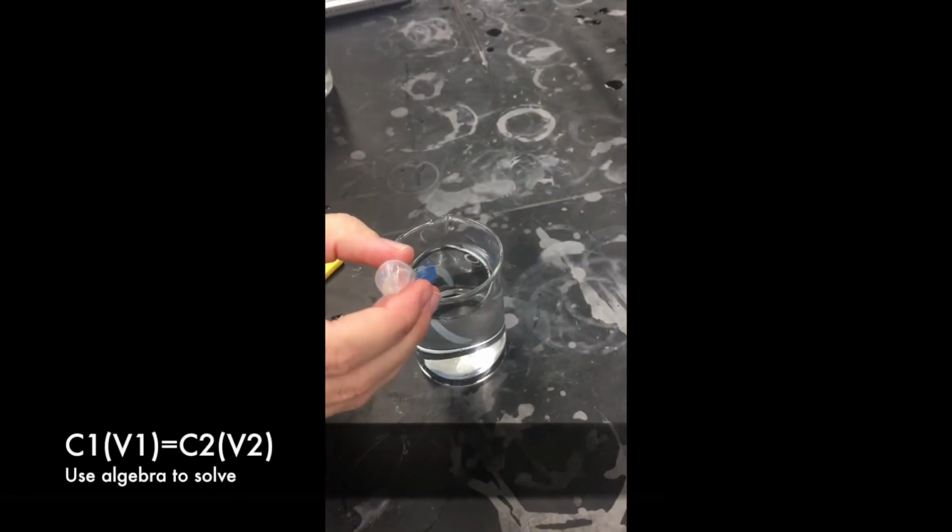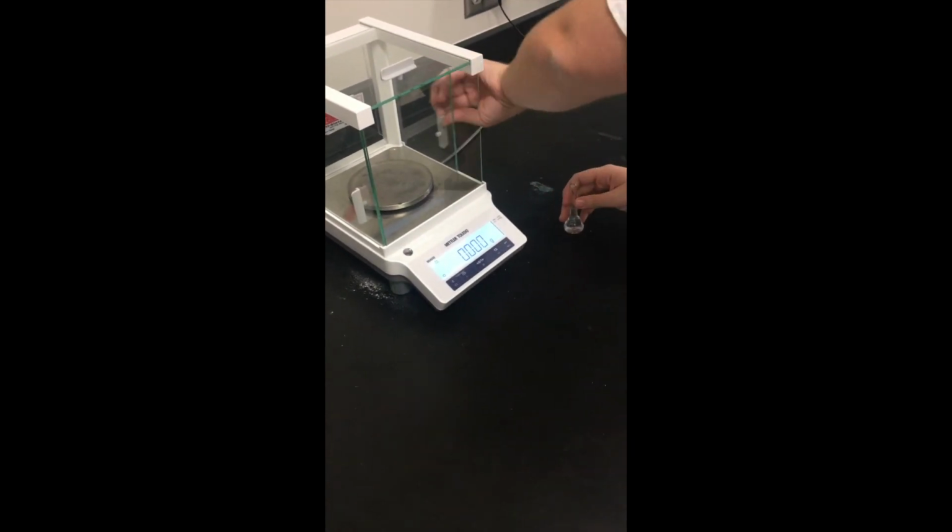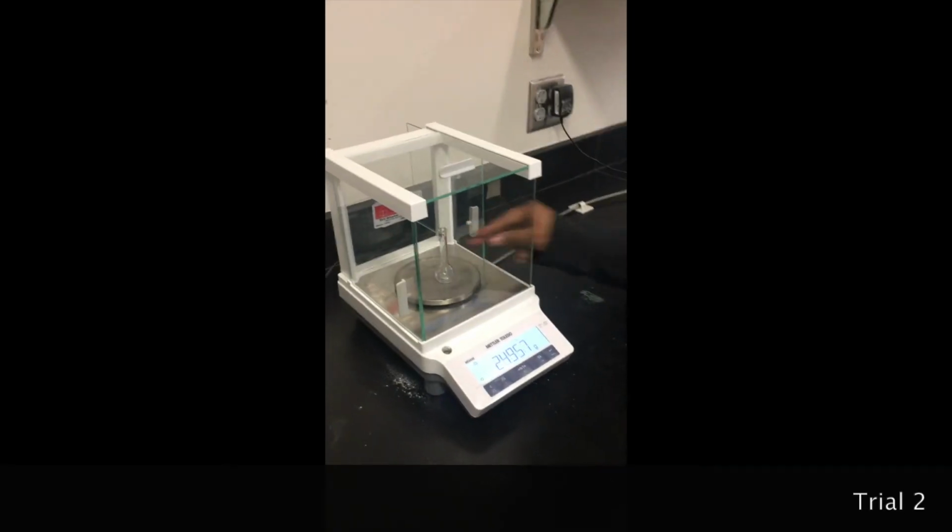Transfer the solution from the pipette into the appropriate glassware. Here we are adding water to the solution to reach a certain point. This will be our V2. You will use this formula to get the concentration of the new solution. Take the mass of both the liquid and the glassware. Repeat these steps for trials 2 and 3. These are the final values.